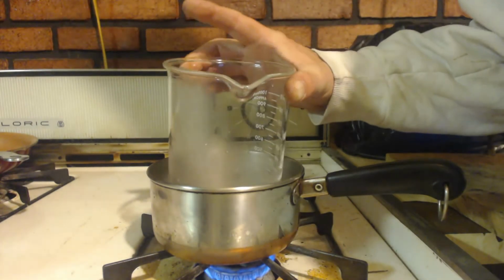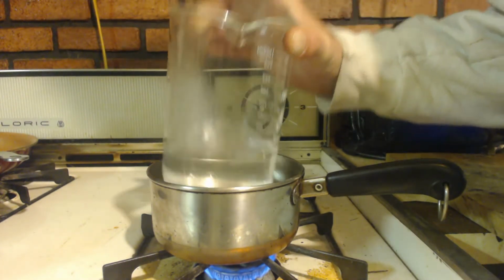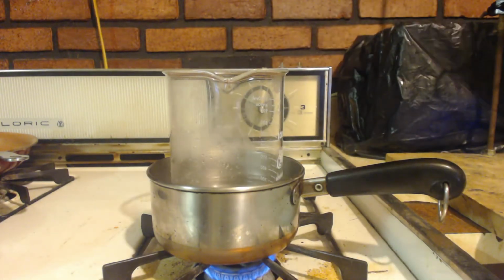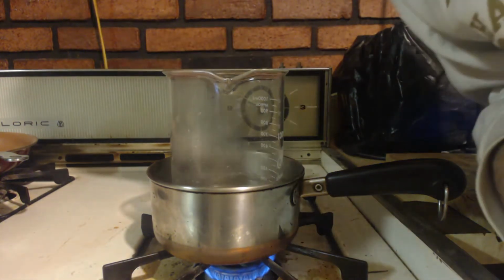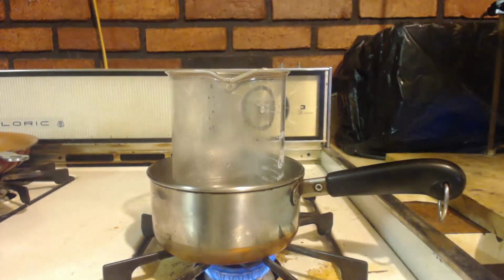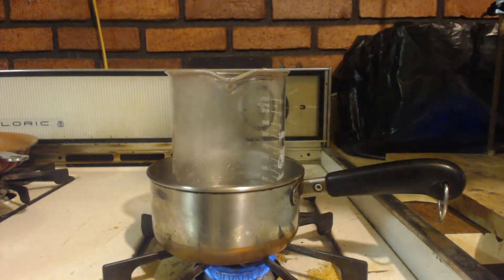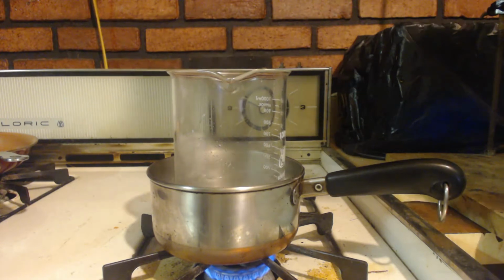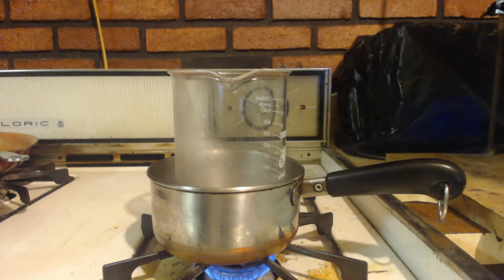It's boiling, and I got some crystals coming out of solution. I'm just going to let it cool down naturally the rest of the way. I don't smell any ammonia. I thought you'd smell ammonia, but I don't. That's the nice thing about this reaction, there's no fumes, no acids, no bases. I mean, you should still always wear gloves and goggles. But you really don't even need a fume hood or anything.